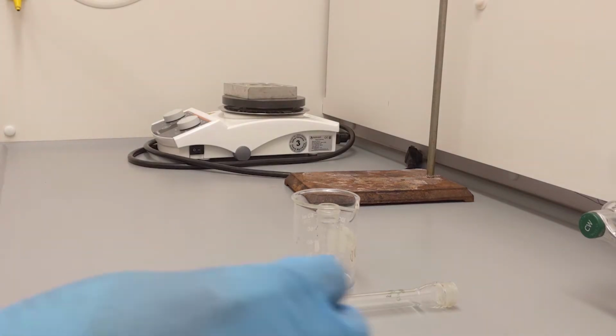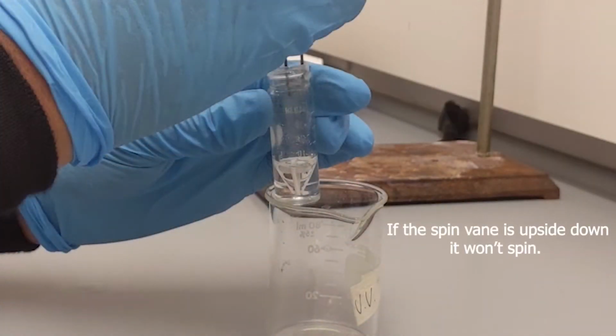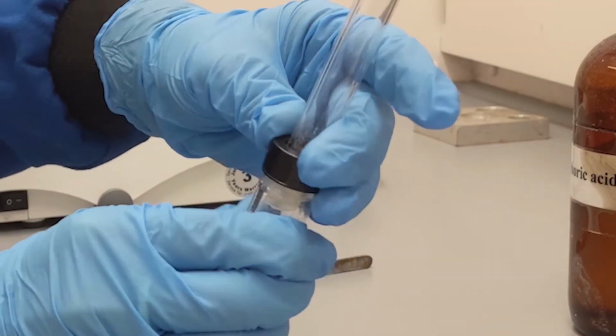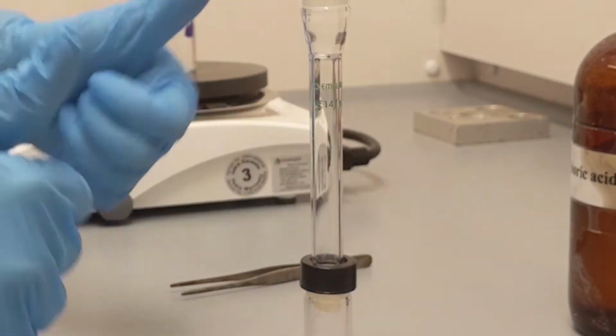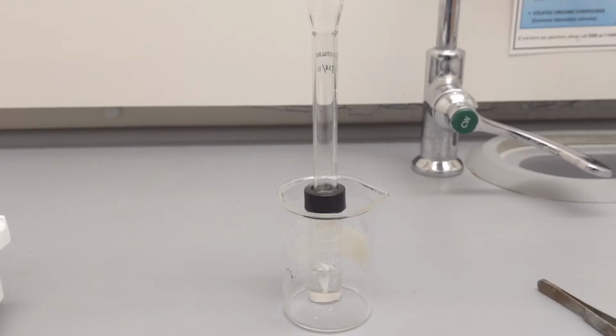Make sure the triangular magnetic spin vane is sitting properly at the bottom of the conical vial, and then connect your condenser on your conical vial. Make sure there is an O-ring between this connection. While you're preparing your hot plate to start the reaction, make sure you let this conical vial sit in a beaker so that it does not tip over.